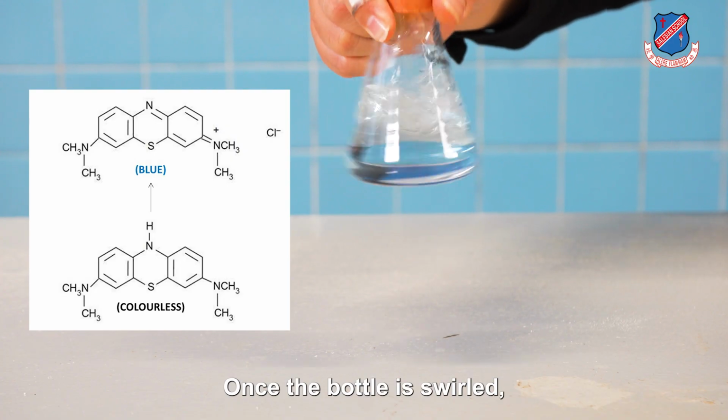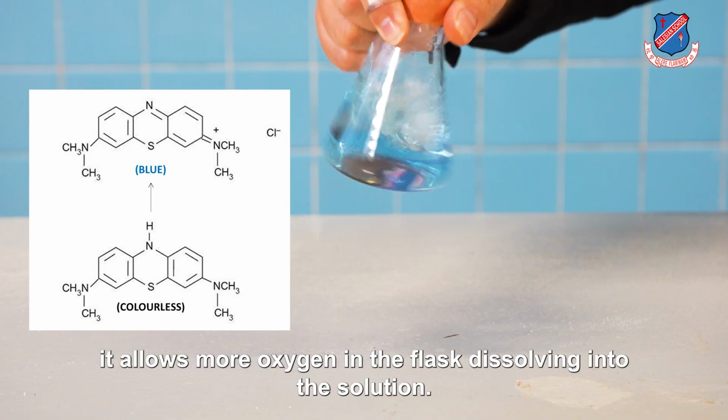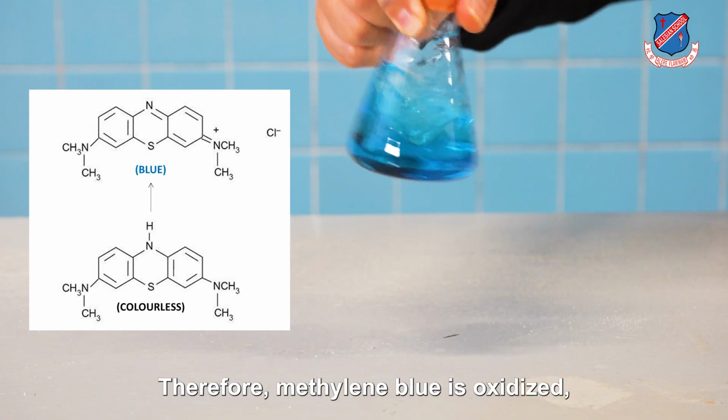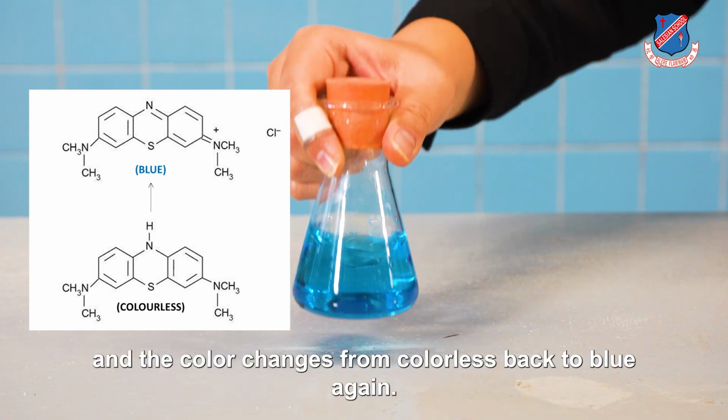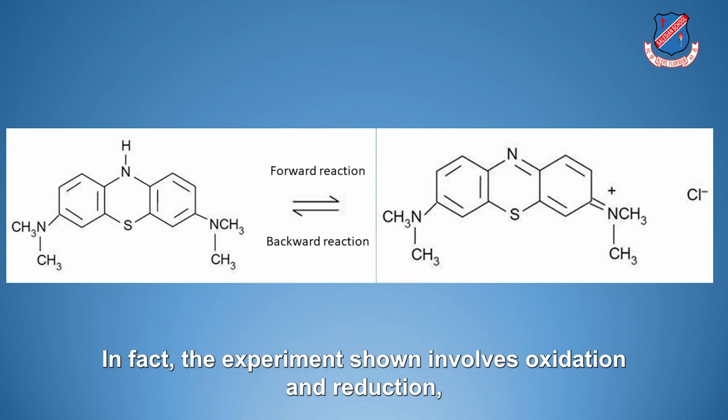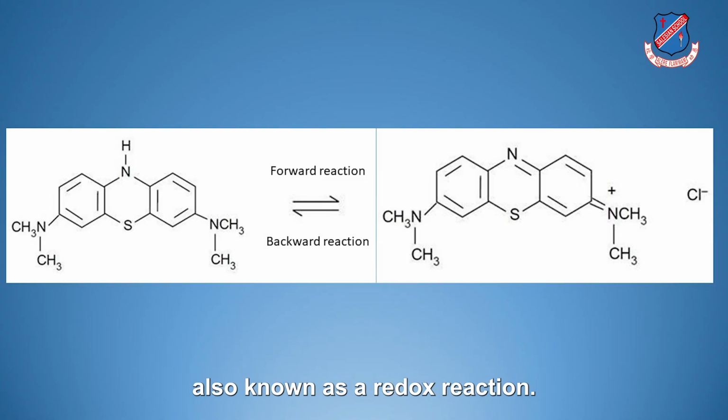Once the bottle is swirled, it allows more oxygen in the flask to dissolve into the solution. Therefore, methylene blue is oxidized and the color changes from colorless back to blue again. In fact, the experiment shown involves oxidation and reduction, also known as redox reaction.